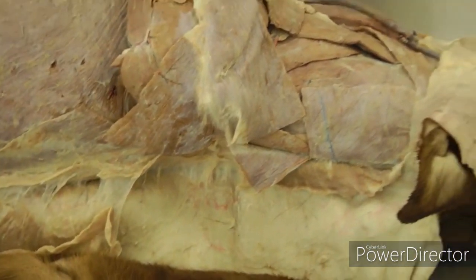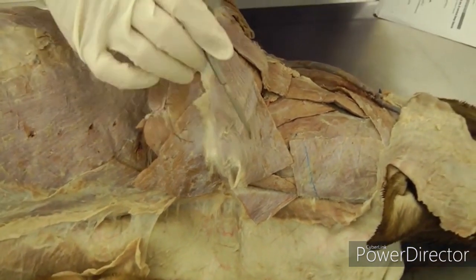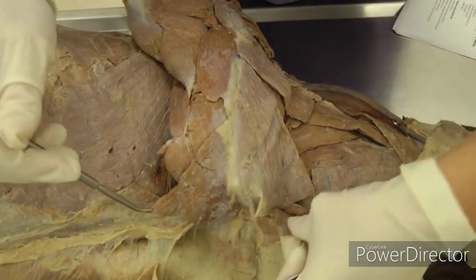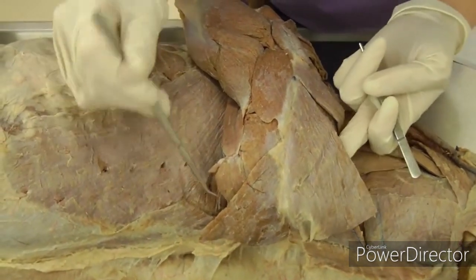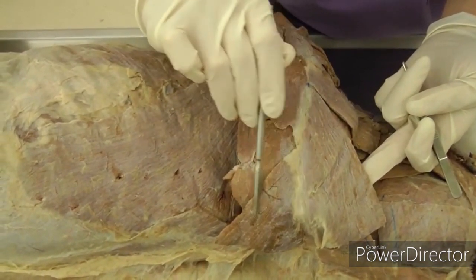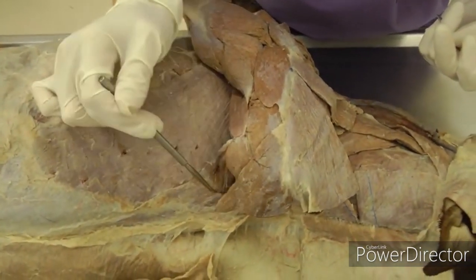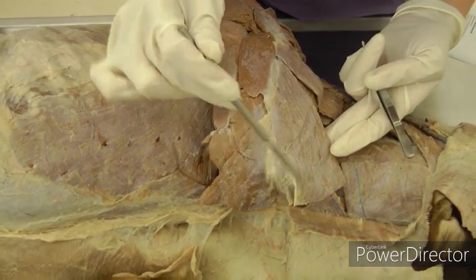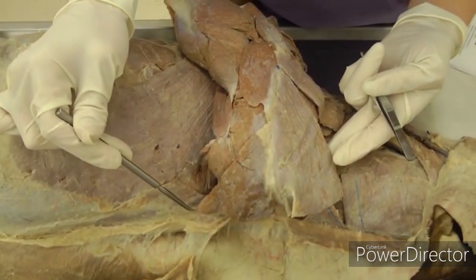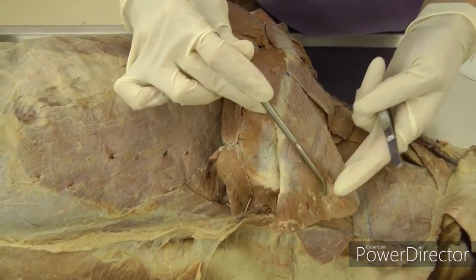Now we're going to identify the trapezius, which is this triangular-shaped muscle here. It's been cut for this lab, which you are also going to do. There are two parts: a cervical part attaching to cervical vertebrae and a thoracic part attaching to thoracic vertebrae. You're going to make an arching cut beginning at the cranial portion all the way along to the caudal aspect of the trapezius, then reflect those pieces.